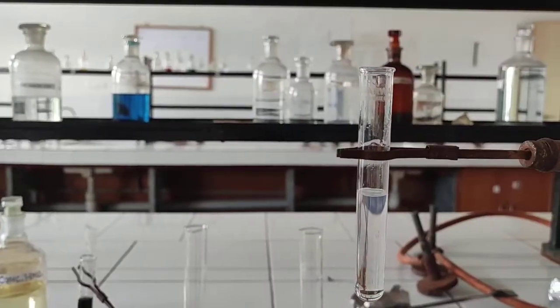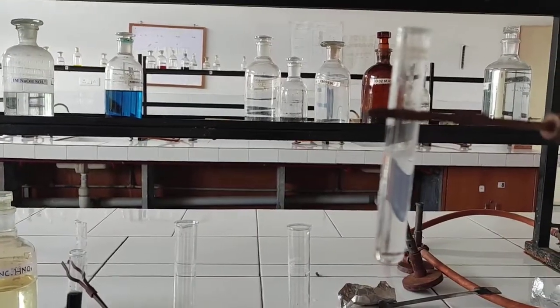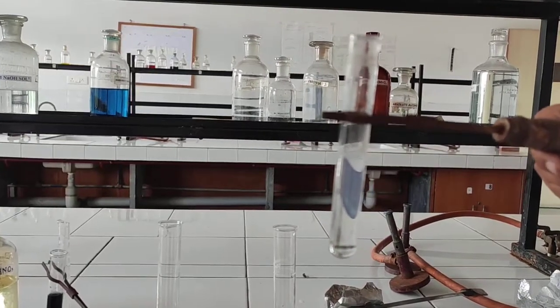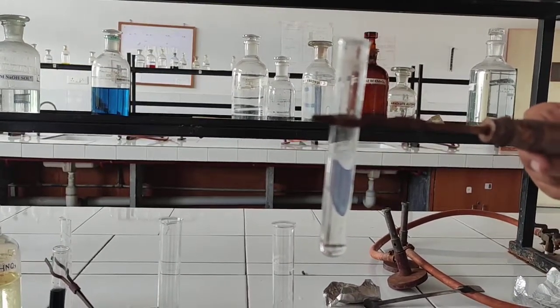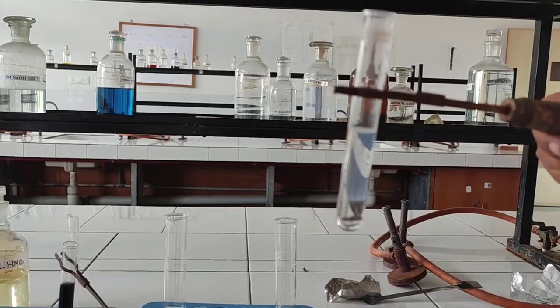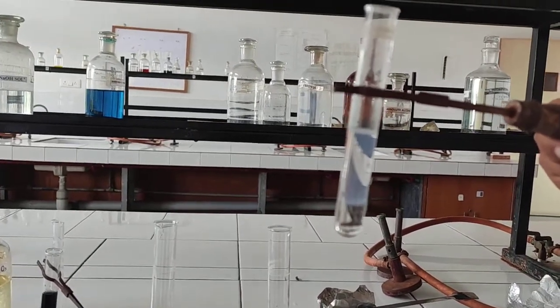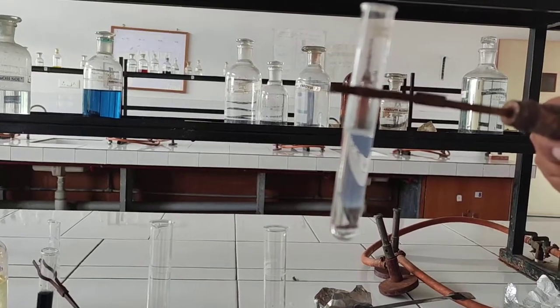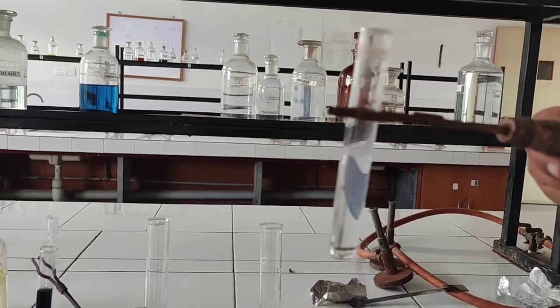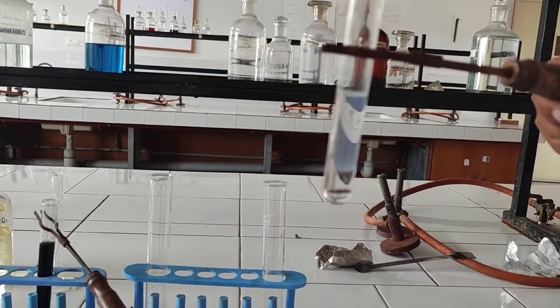This is the chloride test for water for injection. 10 ml of water for injection is taken. Then 1 ml of 2 molar nitric acid is added, followed by 0.2 ml of 0.1 molar silver nitrate. After 15 minutes, there is no change in appearance of the water for injection, confirming that the chloride present is within limit.